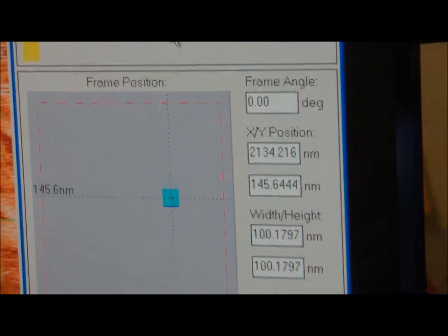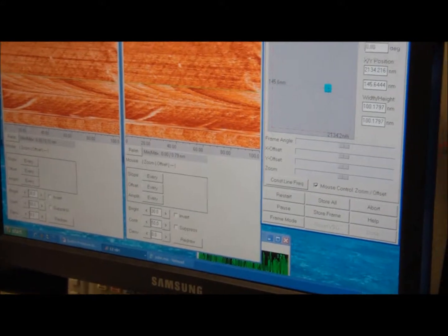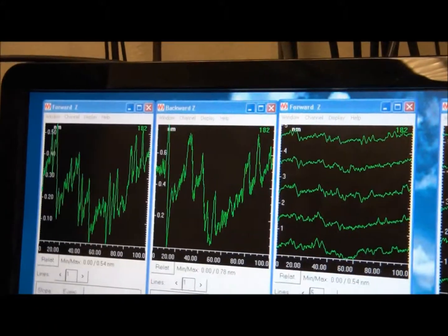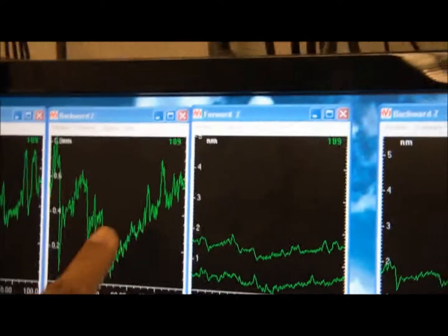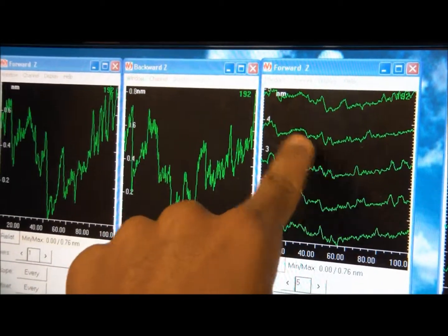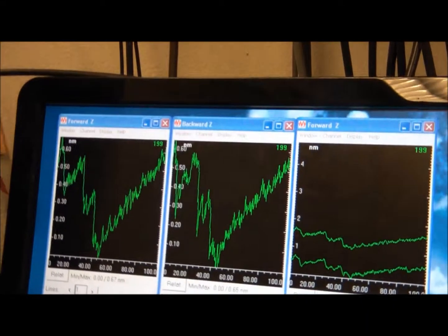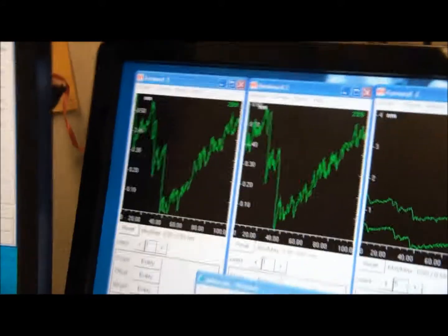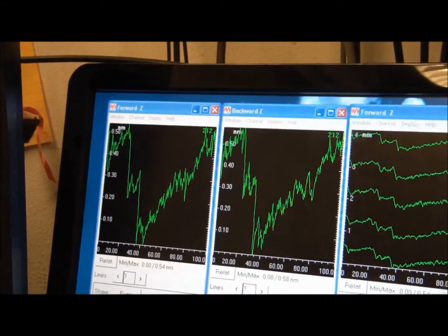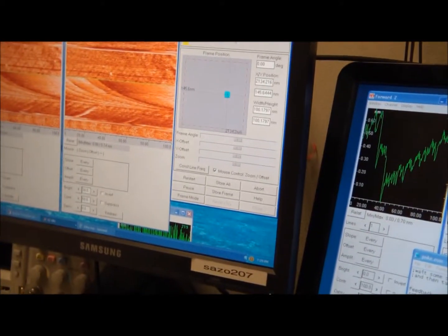And as you can see, again, it's 100 nanometers by 100 nanometers. Looking at these graphs is important because you're looking for consistency in these diagrams. I'm looking here, and these are consistent, pretty much. There's a bit of noise, which is very annoying because on a large scale it looks pretty decent, but then when you zoom in, you can definitely see a lot of the noise, and it's just very, very frustrating, and you have to get rid of it. You definitely have to get rid of it.